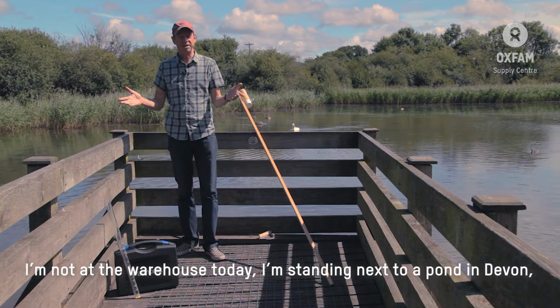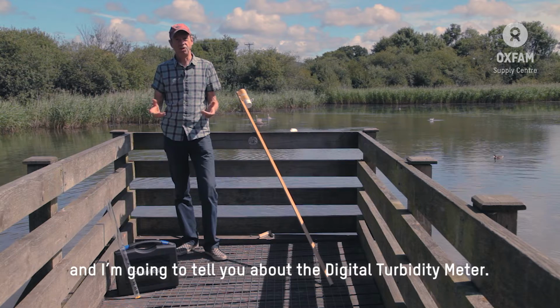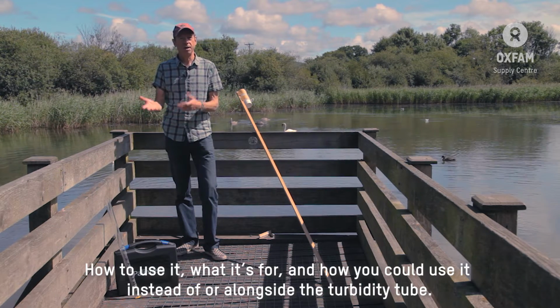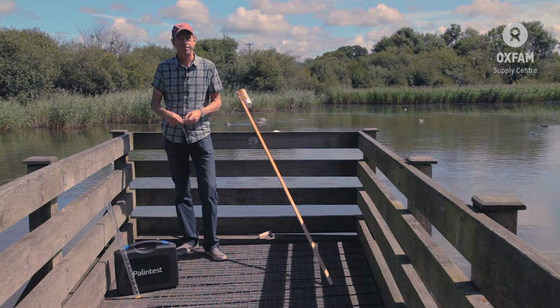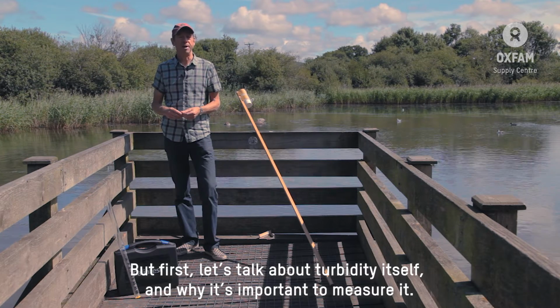We're not at the warehouse today. I'm standing next to a pond in Devon. I'm going to talk about the Digital Turbidity Meter, how to use it, what it's for, and how you will use it instead of or alongside your turbidity tube. But first, let's talk a bit about turbidity itself and why it's important to measure it.